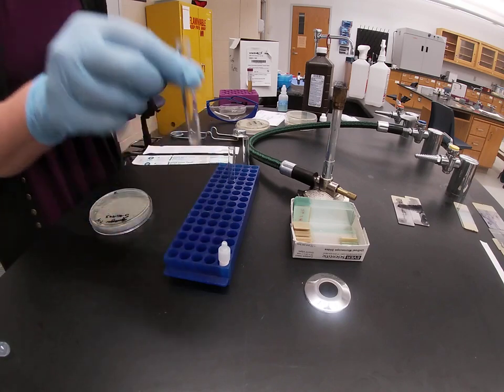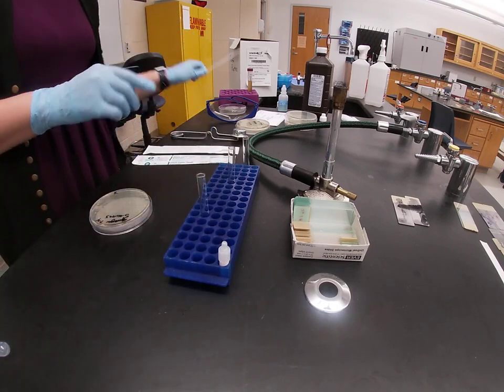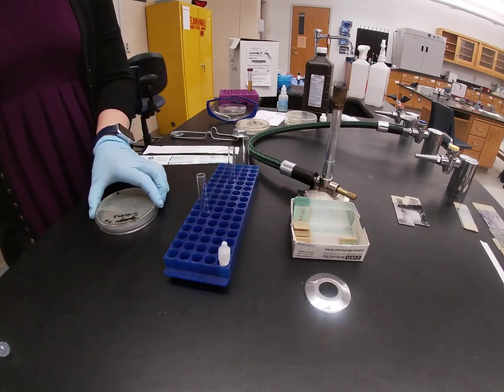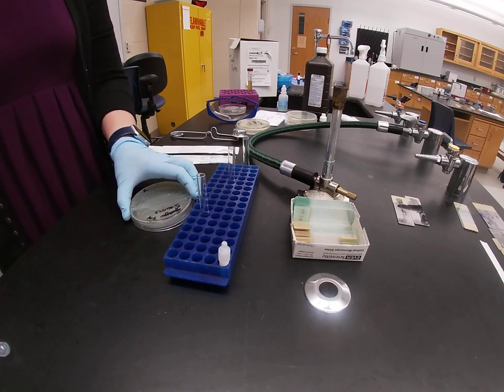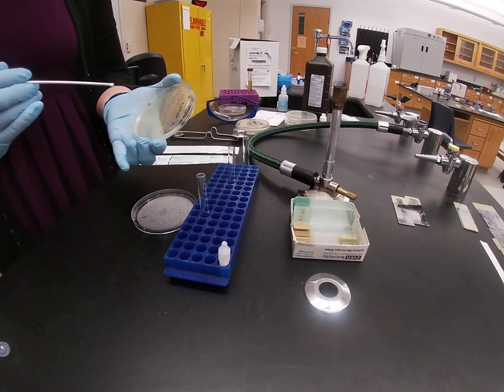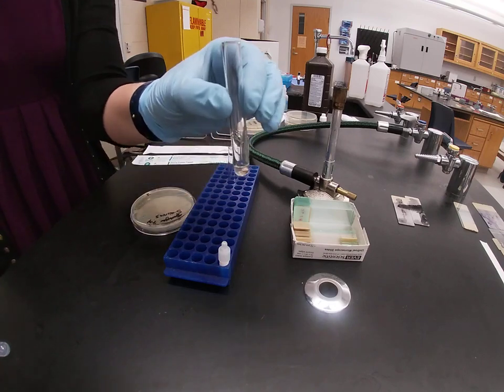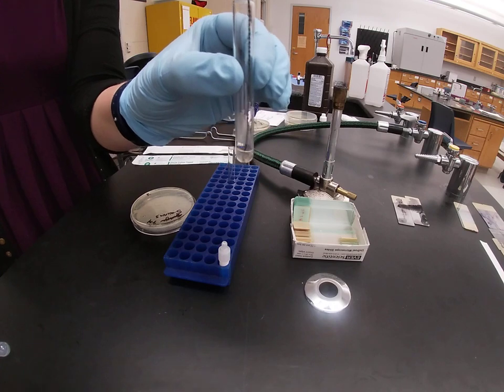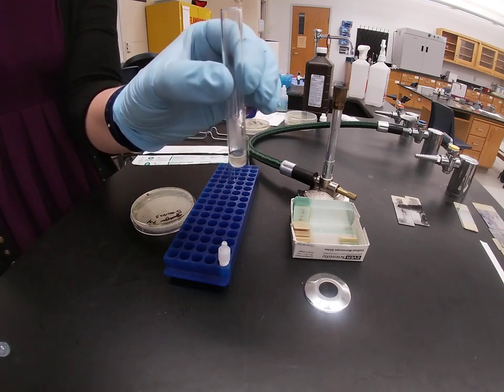After you have your coagulase reagent in a test tube, you are then going to take your loop, incinerate, and then you are going to aseptically pick some bacteria. For a coagulase test, you want to take a loop full of bacteria. You want a good representative sample. And then you are going to mix that directly into the rabbit plasma. Mix it really well. You want to try to break up any clumps, really let it get well mixed.